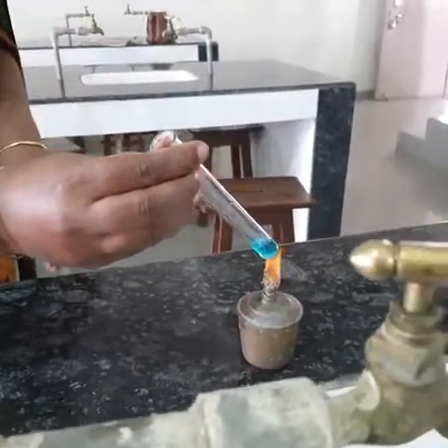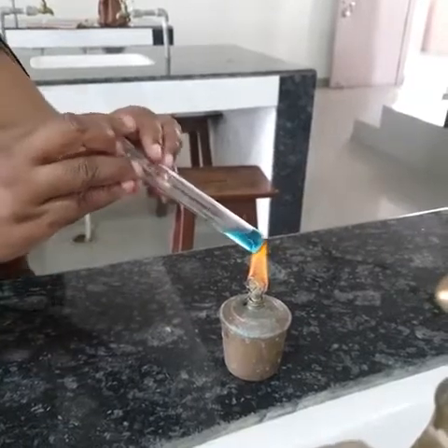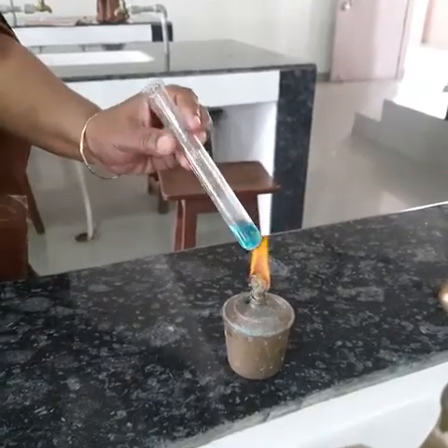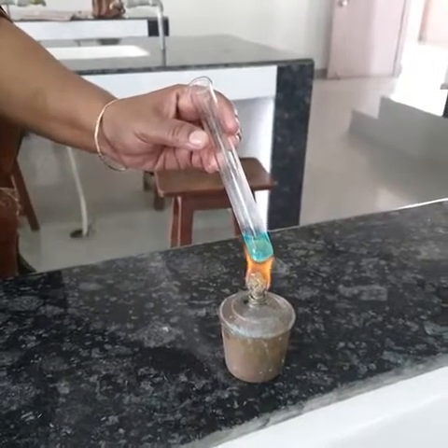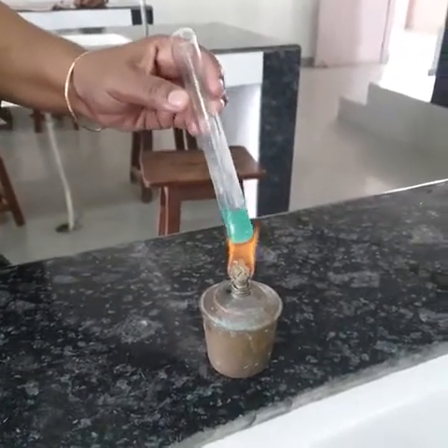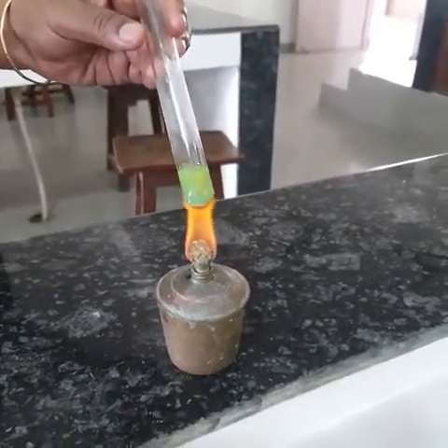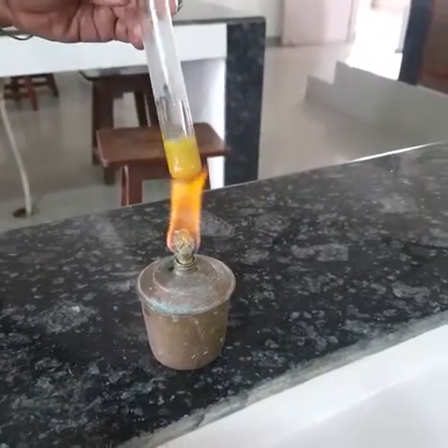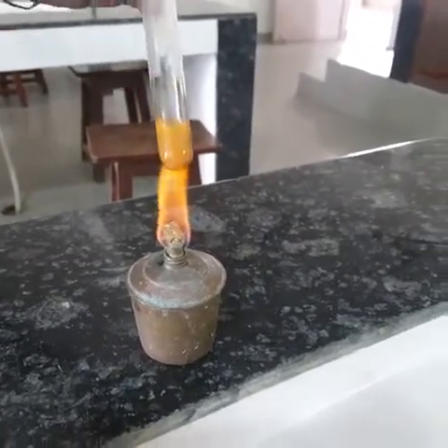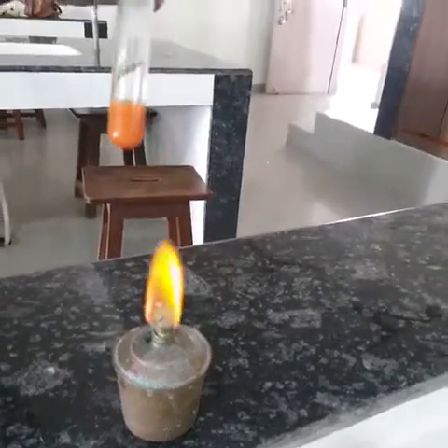I am heating it using the spirit lamp — observe the color change. Slowly it changes color to green, then to yellow, and finally to orange. If the glucose concentration is maximum, it changes to brick red color. We will observe this result after 2 minutes as well.